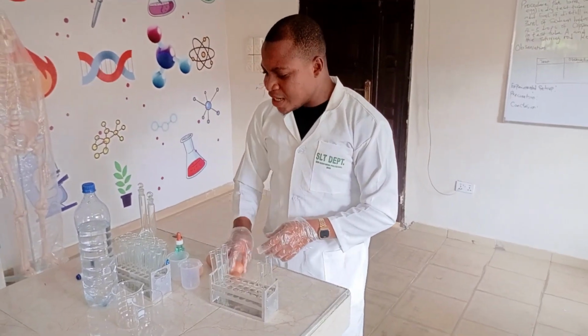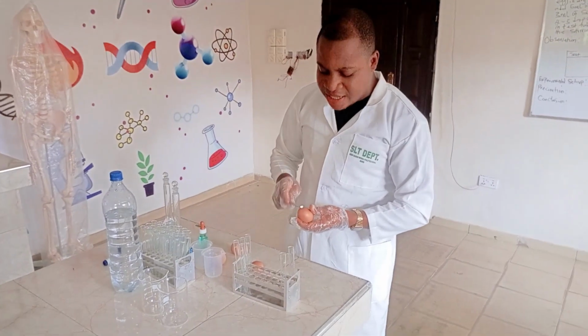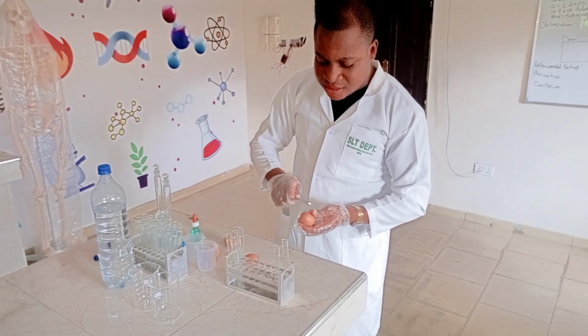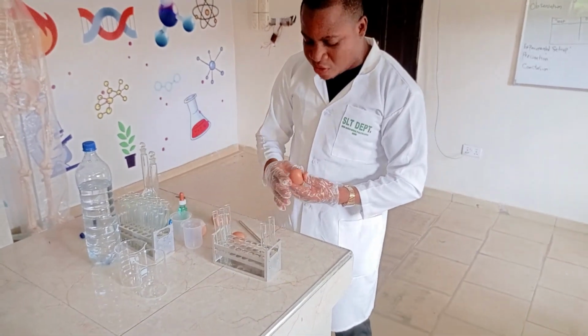I will start by cracking our eggs. I will use my stirring rod to crack the egg. I'm making use of only the egg white, the albumin. The egg white is another word for what? The albumin of the egg.